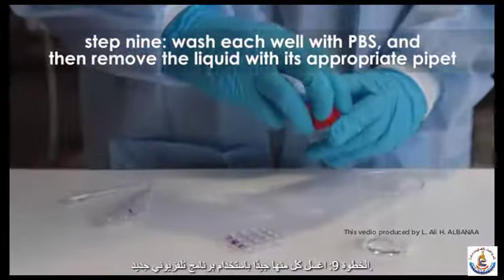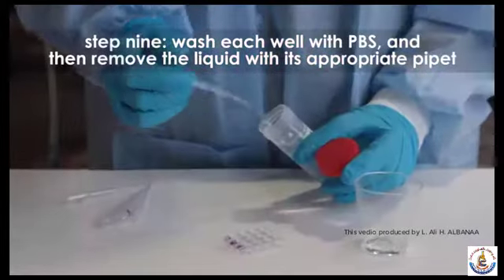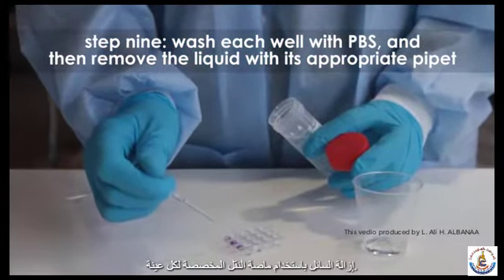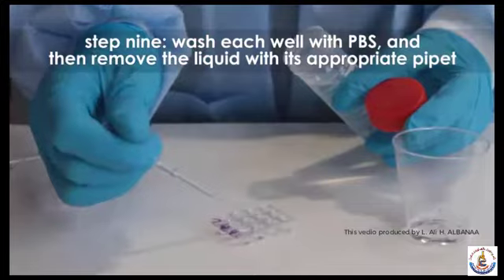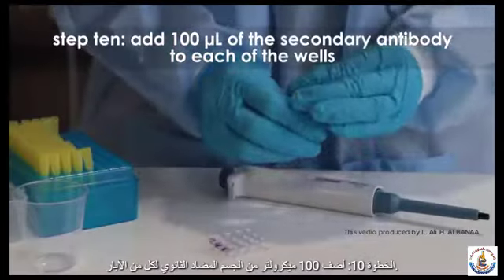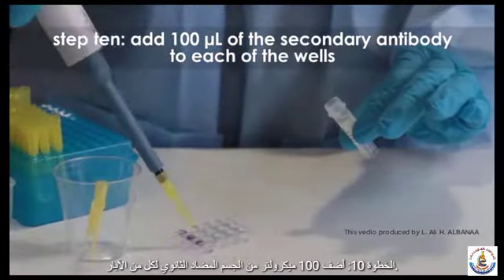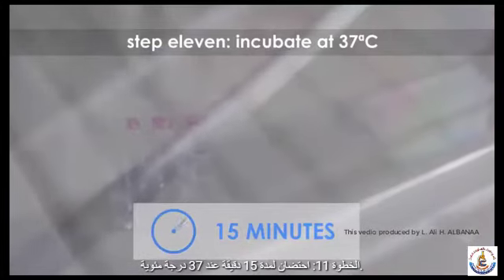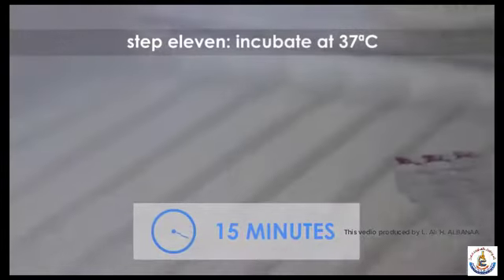Step 9. Wash each well with fresh PBS. Remove the liquid using the transfer pipette designated for each sample. Step 10. Add 100 microliters of the secondary antibody to each of the wells. Step 11. Incubate for 15 minutes at 37 degrees Celsius.